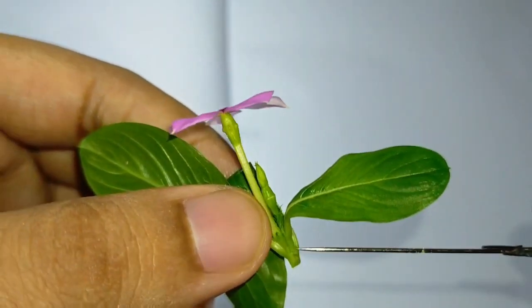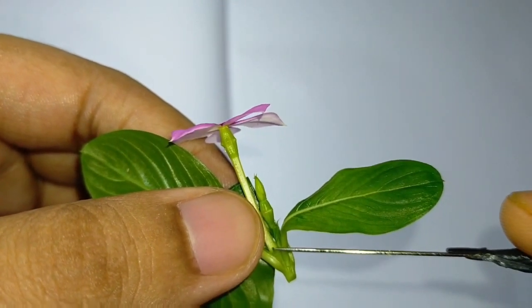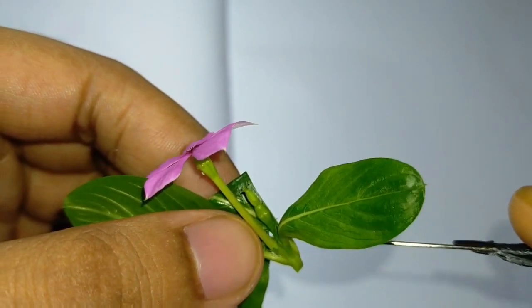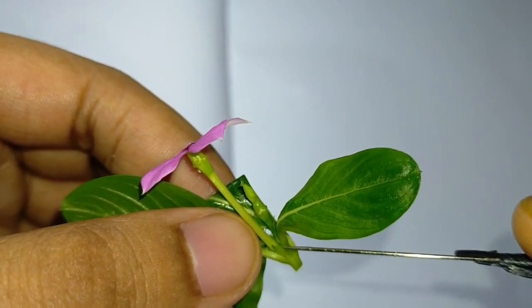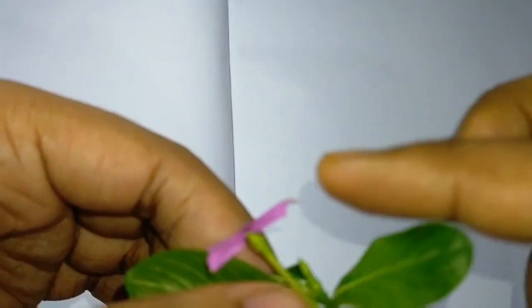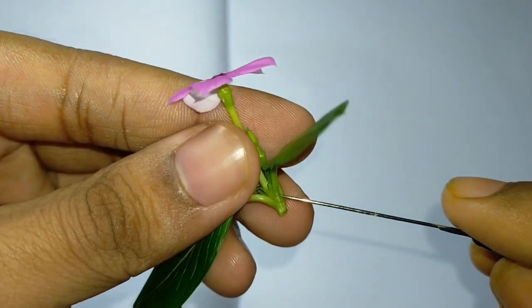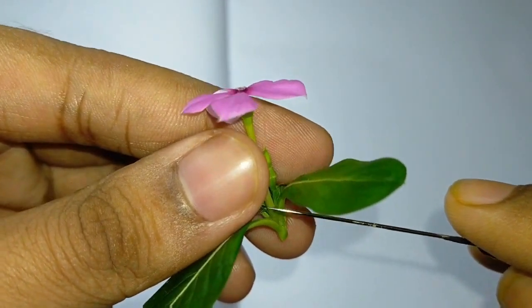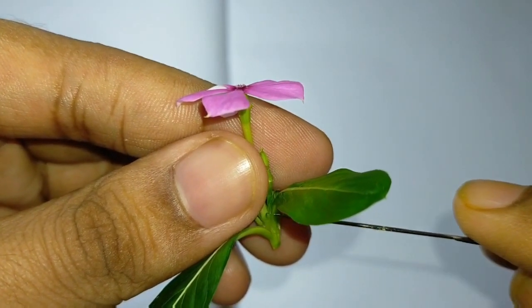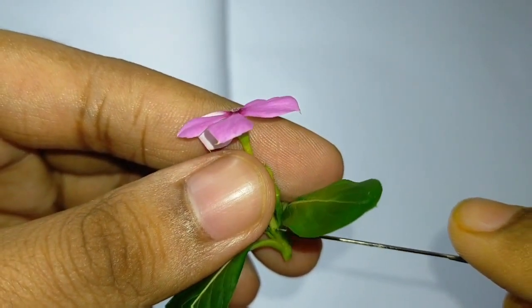You can see the calyx part. It has five sepals which are polysepalous — meaning the sepals are free from each other, not overlapping. So it is polysepalous. The aestivation is quincuncial: out of five, two sepals are external, two are internal, and the last one has one end external and one end internal. The color is green.